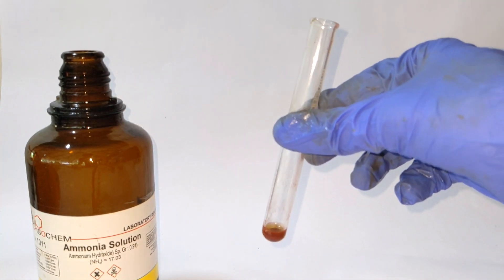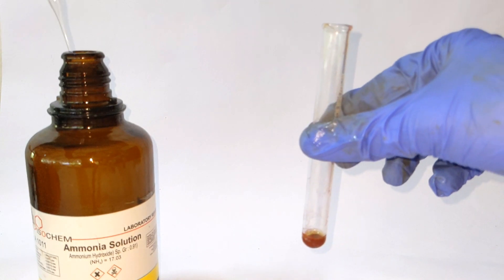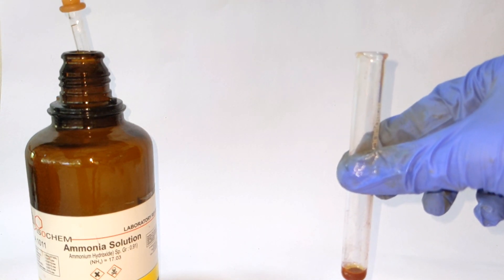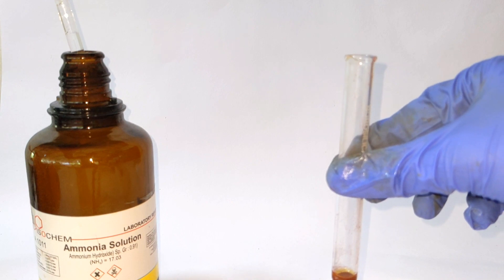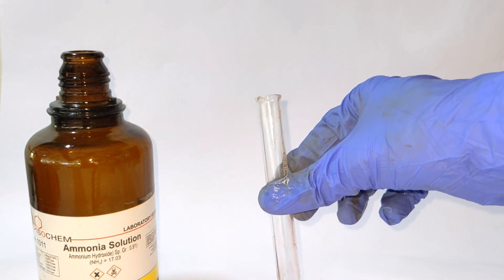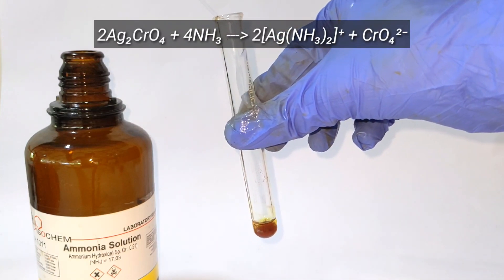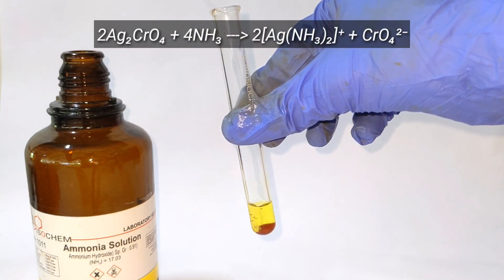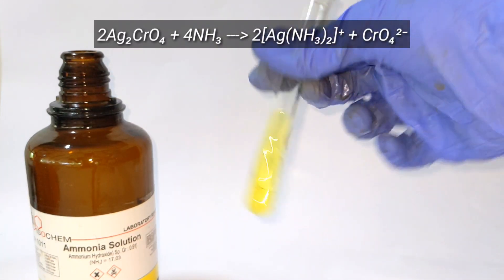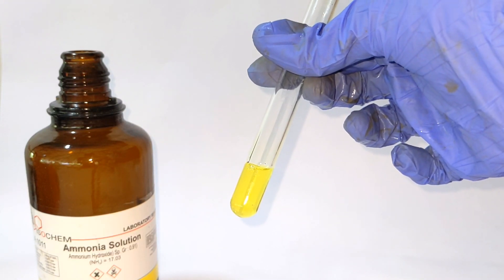We take some amount of the red precipitate of silver chromate and add a few milliliters of ammonia solution. On adding ammonia, the precipitate dissolves due to the formation of the complex diamine argentum, and the solution acquires a yellow color due to the formation of the chromate anion.